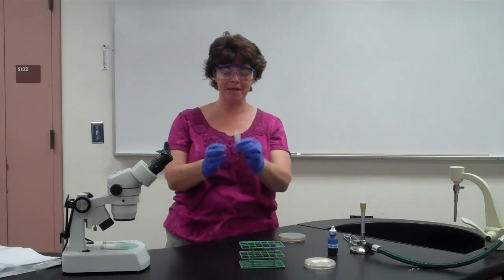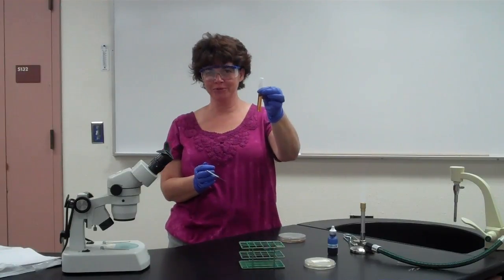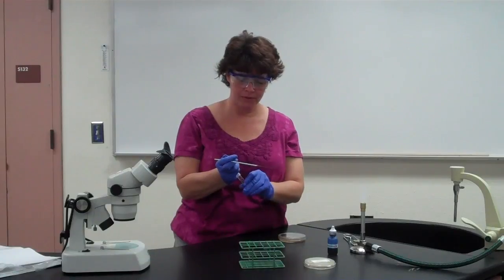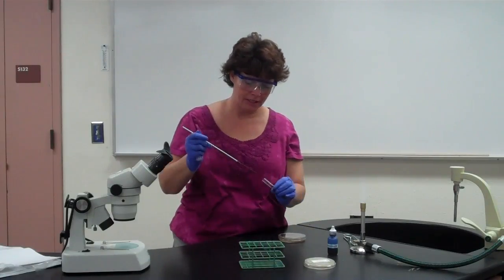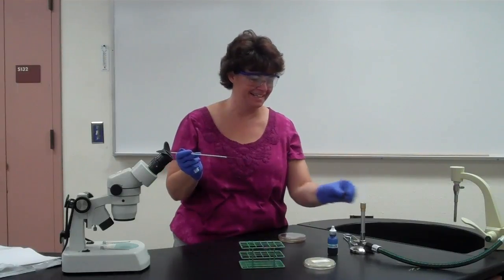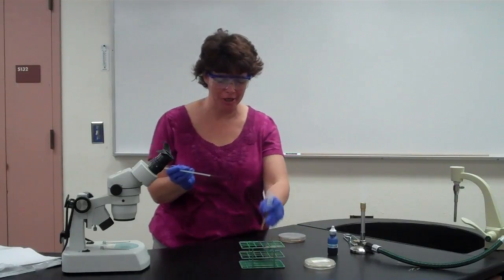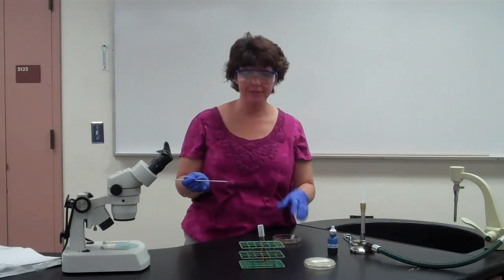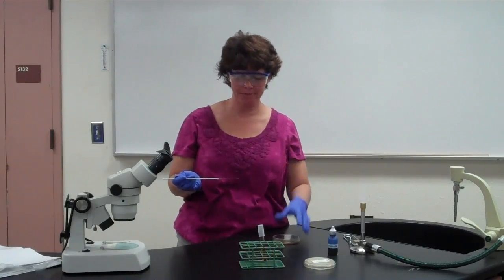A little steamy. That the mold actually grew in the tube. Okay, so you're going to do what you always do. Use your sterile technique. Oops. A little bit hot there. Okay, you won't do that, will you? All right, you guys have learned that what I do in the video you don't do in class. You actually do the proper technique.